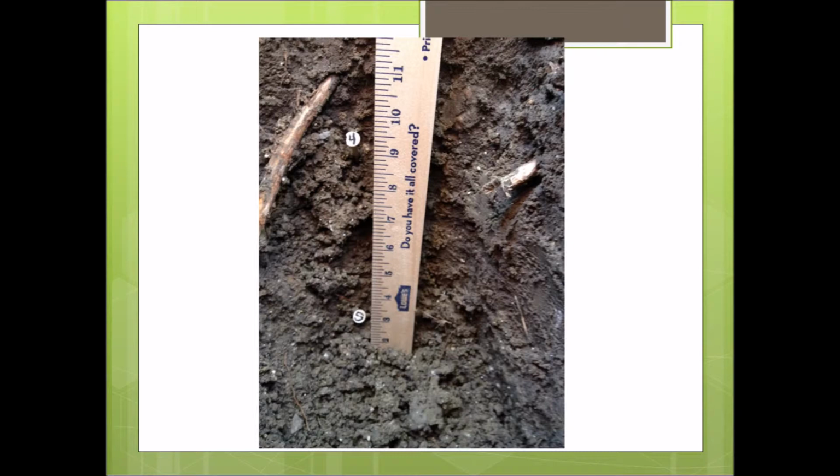Be sure there is a consensus from all the students regarding the depths of the soil horizons. Measure the top and bottom depths of each horizon, beginning at the top surface of the profile. Start with the meter stick or tape measure at 0 centimeters at the top of the profile. Note the depths at each of the horizons and at the end. Record the top and bottom depth of each horizon of the soil horizon definition page.